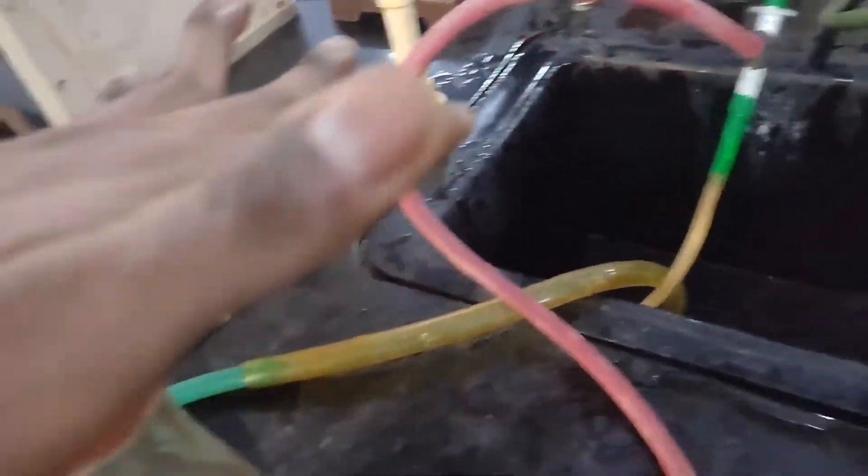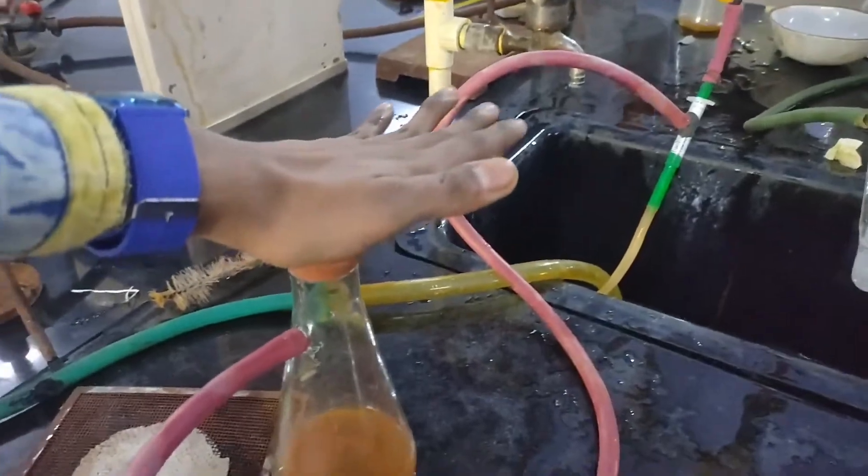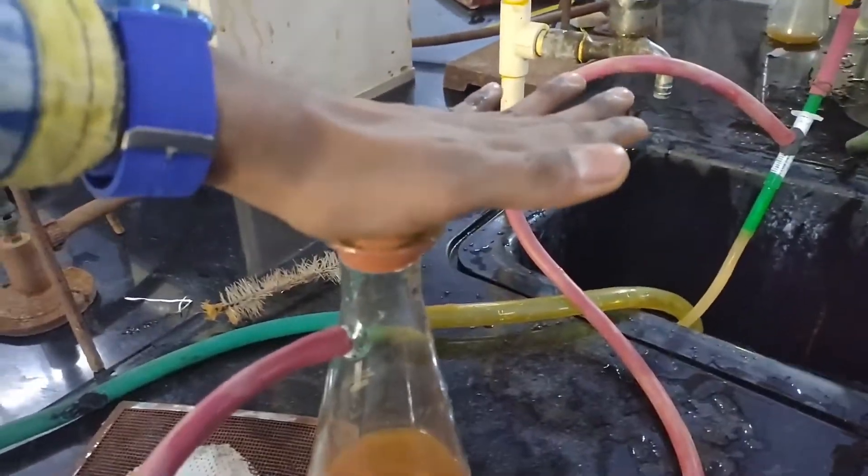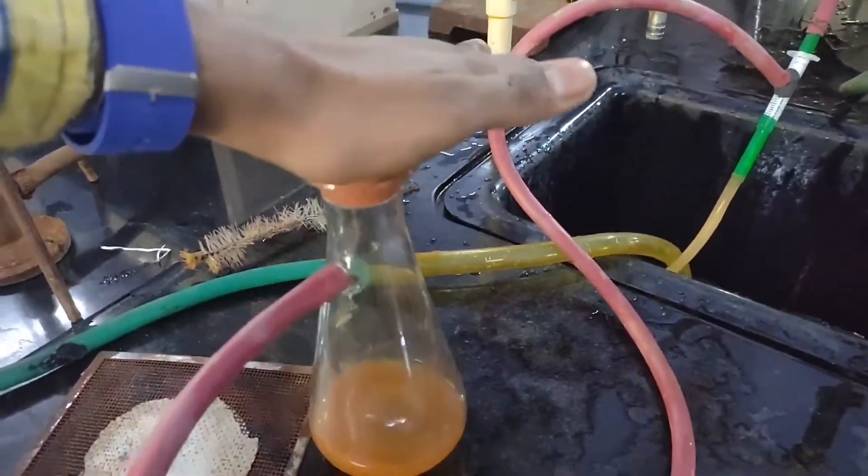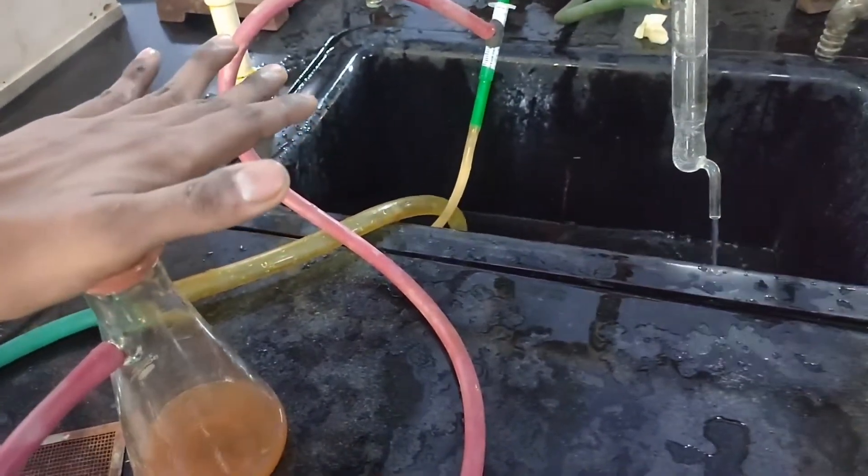This is the working of our vacuum aspirator and you can see it creates better vacuum than the glass vacuum pump which you can see on the right. I can lift up the flask very easily.